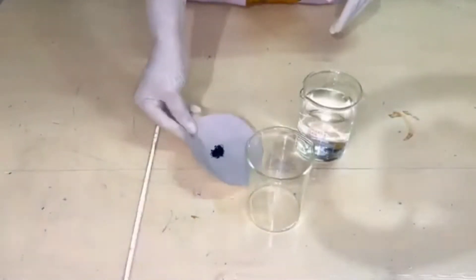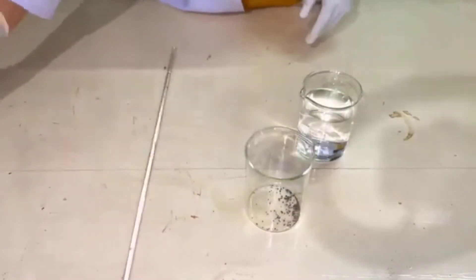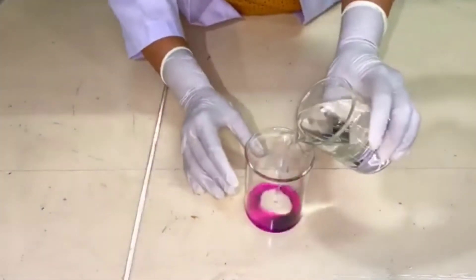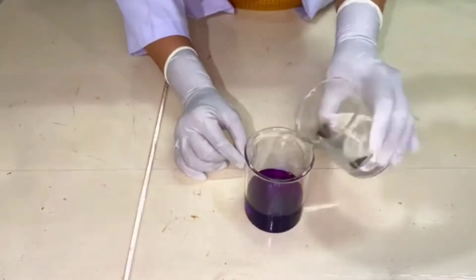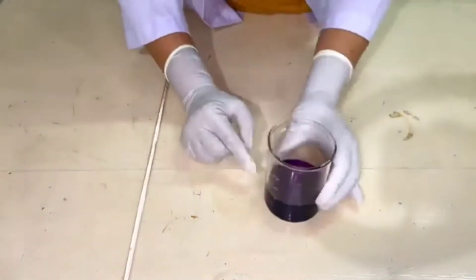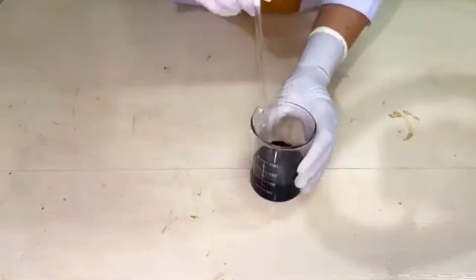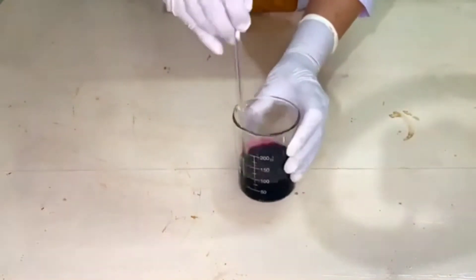For the preparation of potassium permanganate solution, pour approximately 0.9 grams of potassium permanganate salt in 100 ml of water in a beaker, and stir it continuously until it dissolves.